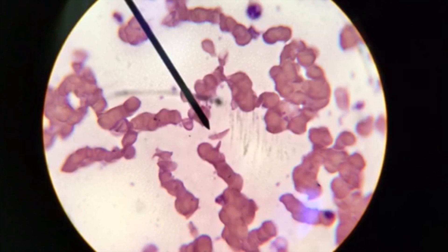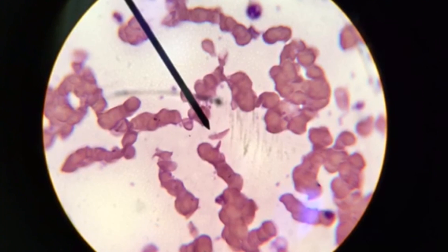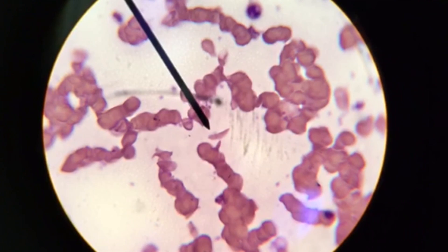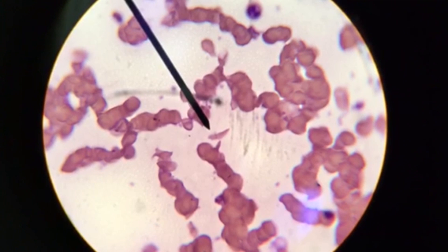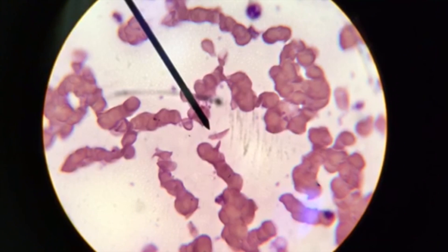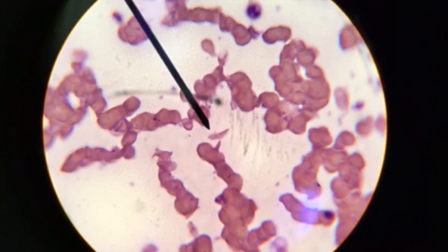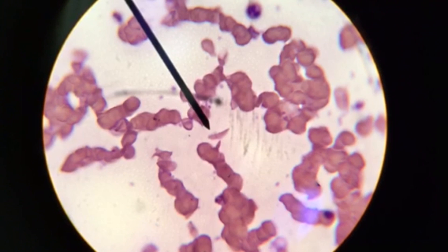This is sickle cell anemia. The pathophysiology of sickle cell anemia is characterized by the loss of red blood cell elasticity. Remember, normal red blood cells are quite elastic and they live for about 90 to 120 days in circulation. The elasticity of a normal red blood cell allows the cells to change shape to pass through capillaries.